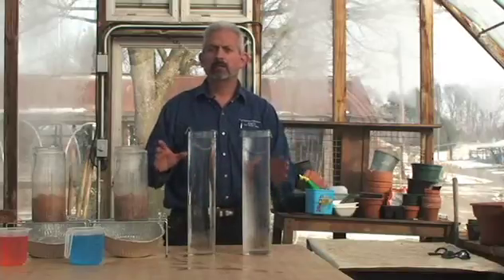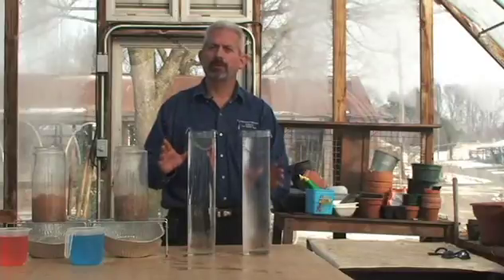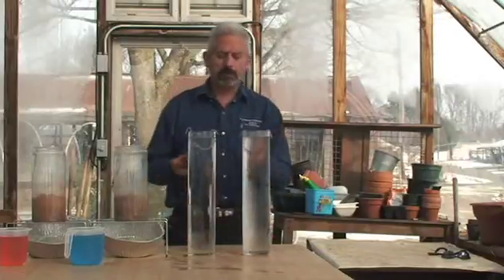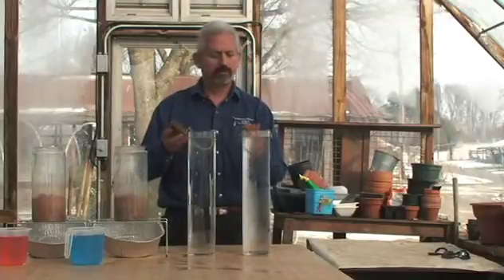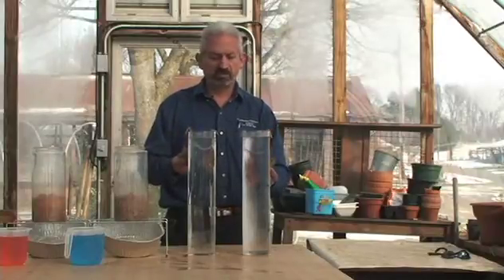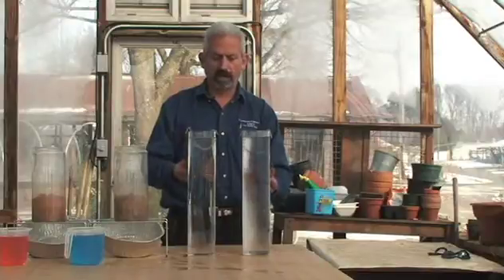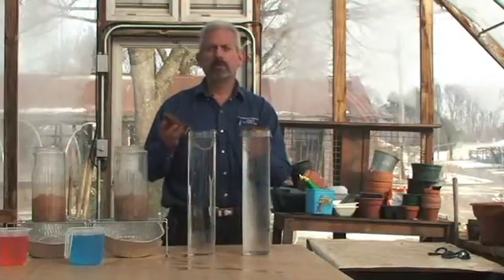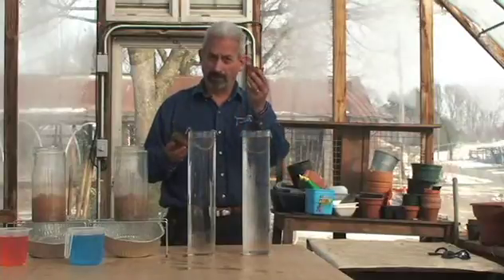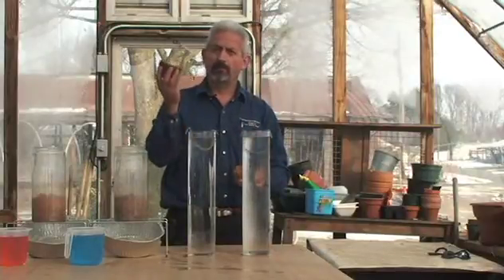The Slake Test is a great qualitative test to show us if our soil is functioning or not. Any landowner, farmer, or even a gardener can do this simple test. All it consists of is getting two glass jars or two cylinders, and then you collect your soil — one from an area where you do a lot of tillage, and one from an area where you don't.